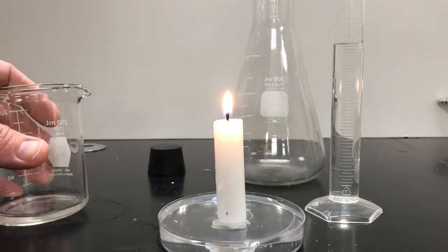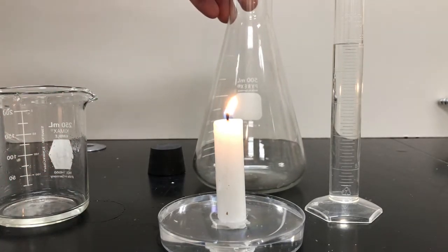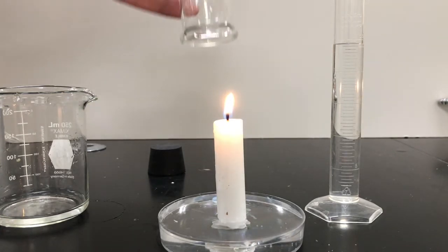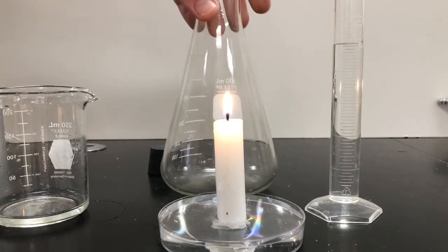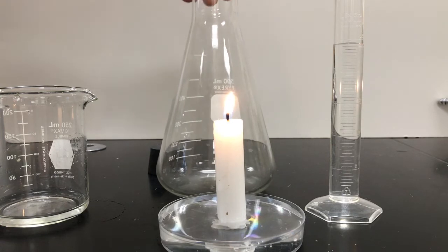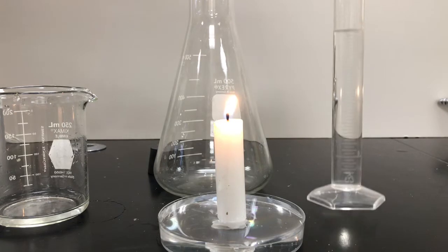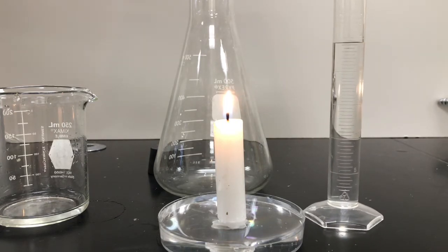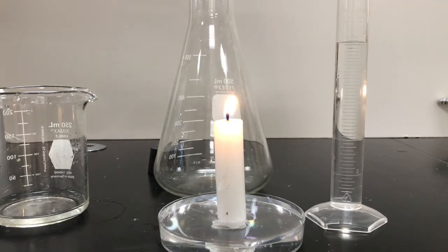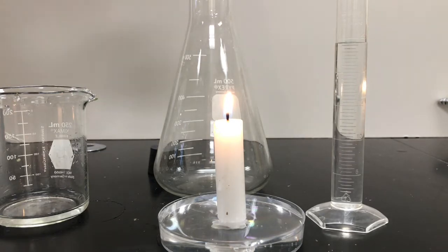And I'm going to take the Erlenmeyer flask and put it over the candle, with the mouth of it just over it. Then after it's done, I'm going to pull the Erlenmeyer flask off and test the gases that are inside with this liquid. It looks like water, but it's not. In here is lime water. If something happens, it shows the presence of a chemical. We'll talk about that in a minute.